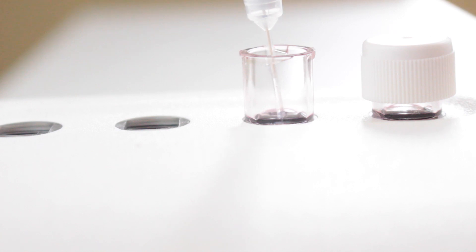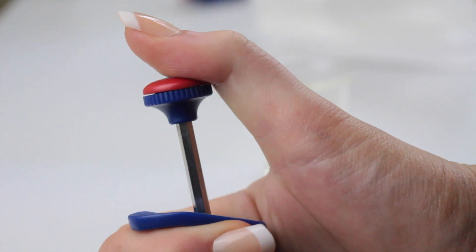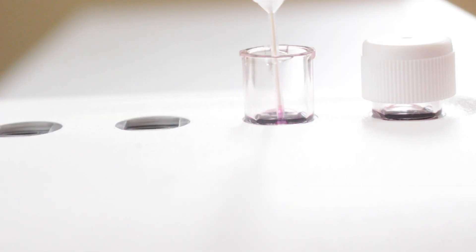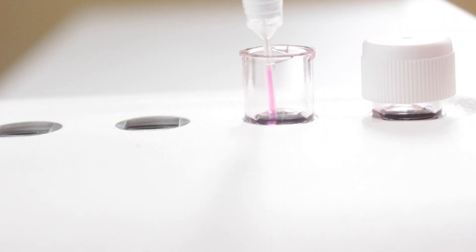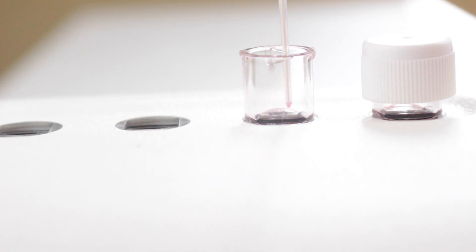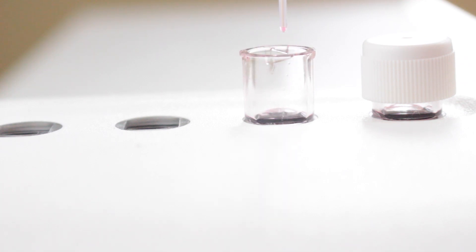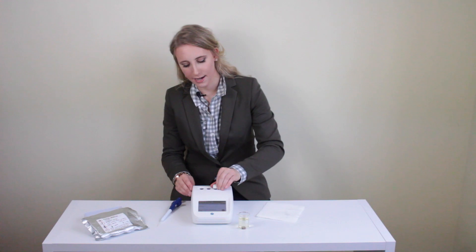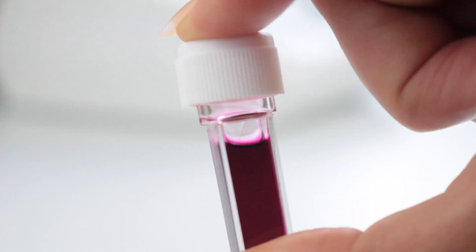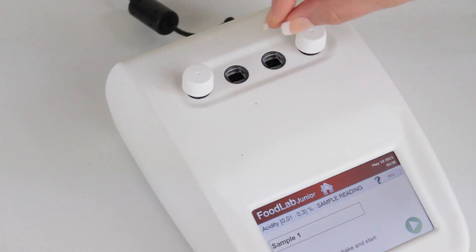Place the pipette tip into the reagent — you can place it all the way down until the pipette tip touches the bottom of the reagent. Then press the piston down to expel the oil and draw it back up while it's still in the reagent. Go back and forth and rinse the pipette tip with the reagent — this will make sure that all the oil is out of the pipette and in the cuvette in order to get an accurate reading. Put the cap back on, gently invert the cuvette, and place it into the proper blinking blue reading cell.